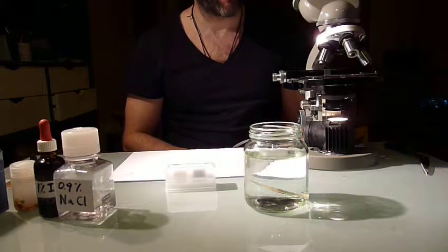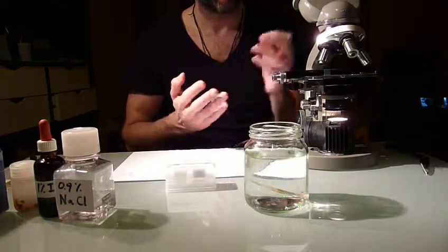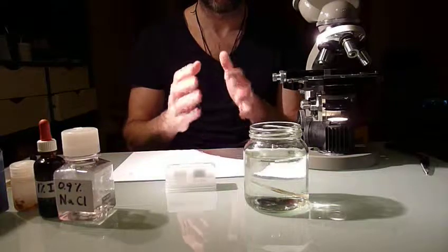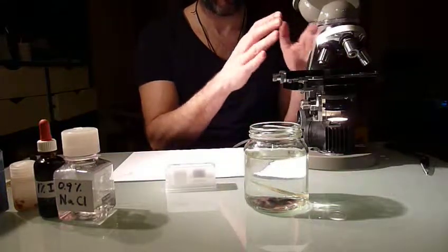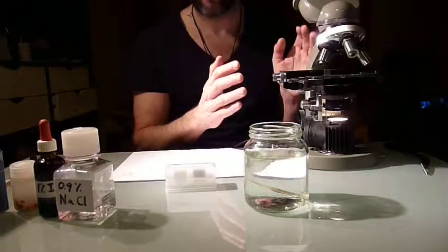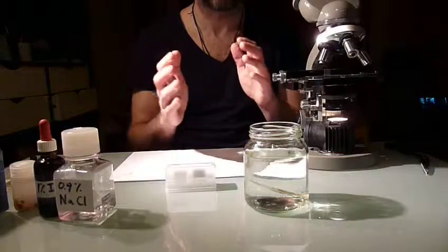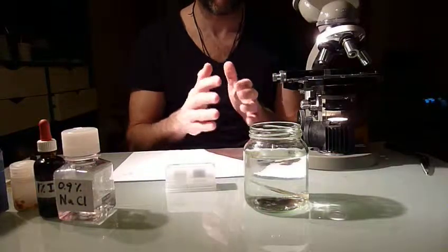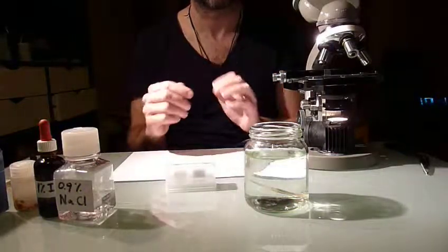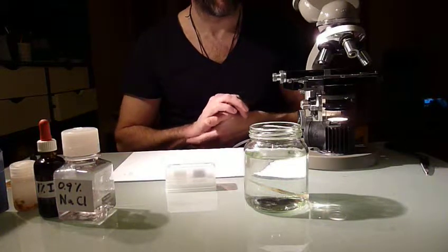Okay, later I'll also have a look for pictures of what the differences are between yeast, which I will show you in the video because I don't have any cysts here, so that's why I use the yeast. I'll explain a bit what the differences are between the yeast and the cysts and how you can discriminate between them. That's for another video.